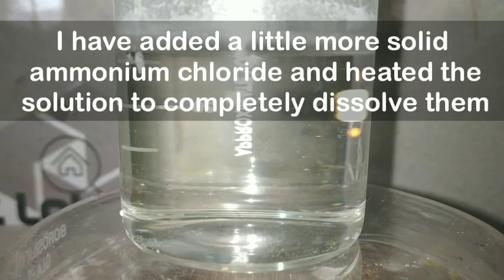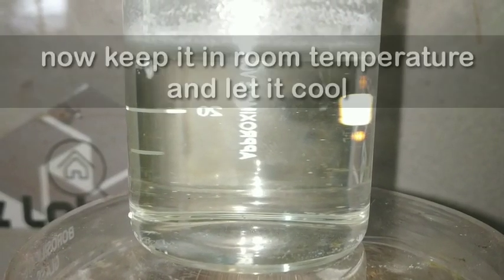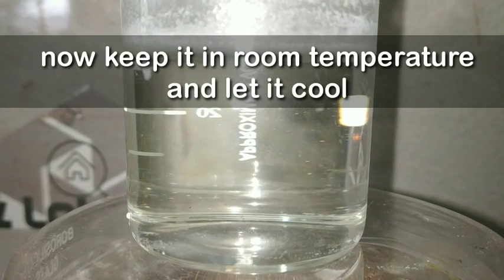Ammonium chloride is less soluble in cold water, so on cooling the solution the crystals start to separate. These crystals have a beautiful snowflake-like appearance — you can see in the video the crystals start to reappear as snowfall. We will be using these crystals to make our second crystal globe.